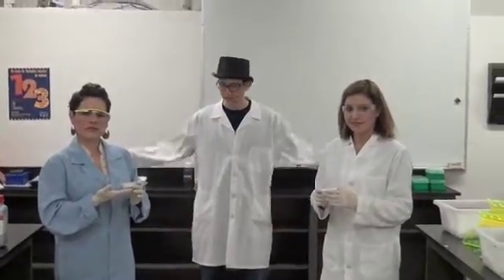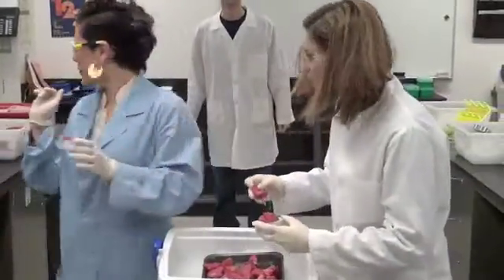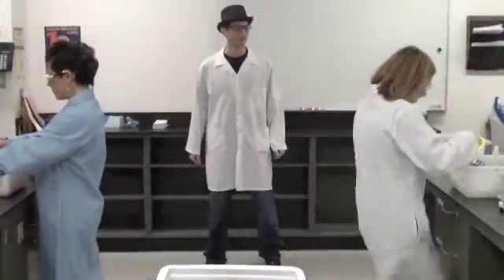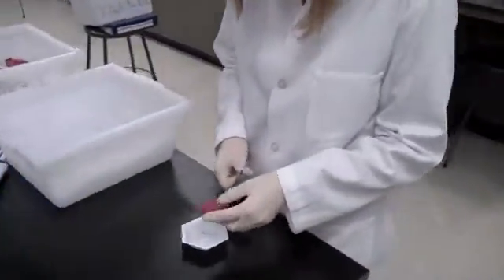I'm Don G, and I'm joined by our judges, Mistress Entropy and Dr. Beckman. Now let's see who will rise to the top here on Ionic Biochemist Again! And they're off. Biochemist Dicer chooses her specimen of meat wisely. Curate doesn't look so confident in picking her medallion of beef. Right you are, Mistress Entropy.